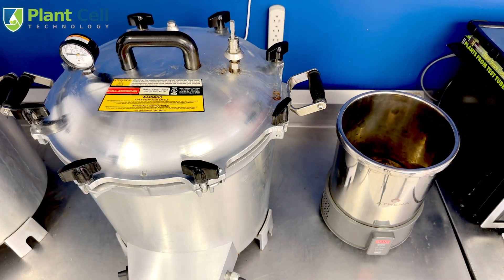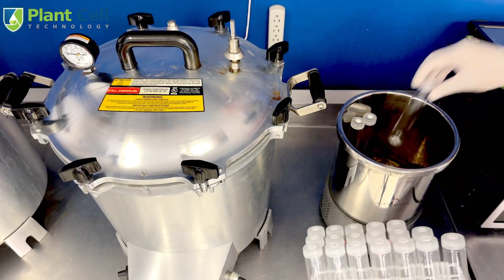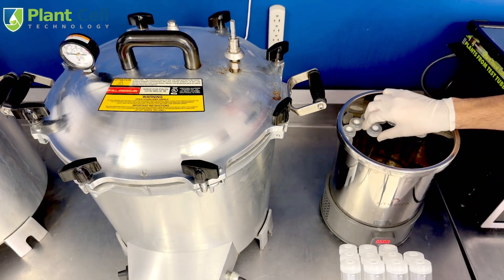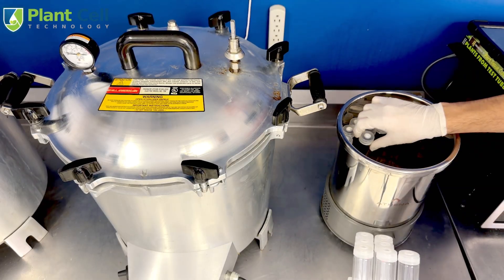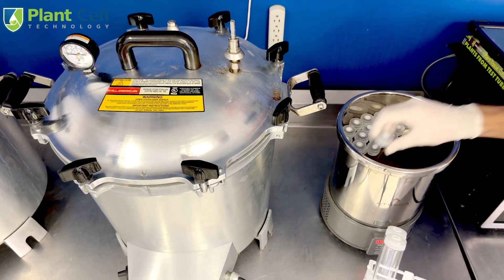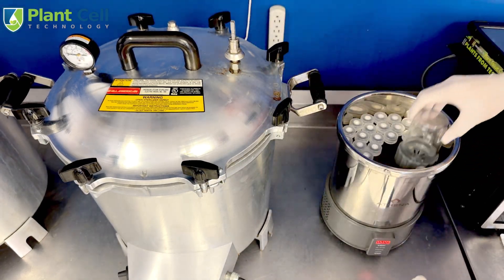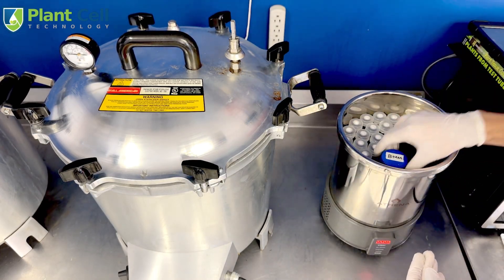For the Athena, it also has an inner liner. However, the Athena does not have a hose that goes all the way down, so it cannot bleed a pocket of air inside the sterilizer. For that reason I don't use the inner liner — I just take it out and use the bottom tray. The bottom tray is almost flat with just a few small holes, so test tubes sit very nicely. I then put my media and a biocoupler in there — the 8-ounce biocoupler fits in the Athena sterilizer.